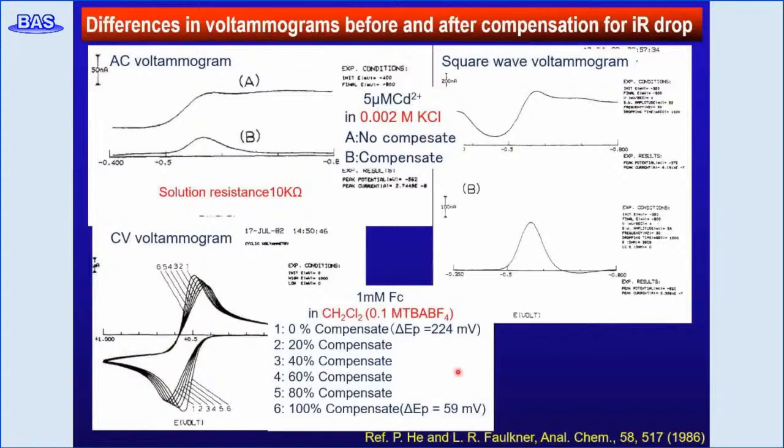Here is the actual reported change in voltammetry before and after IR compensation. The first example is the AC and square wave voltammetry of cadmium 2+ reductions. Without compensation, the peak is not visible, but after the compensation, the peak is clearly observed. Also, in the case of oxidation of ferrocene in low dielectric constant dichloromethane, the peak separation is 224 mV without compensation, which is very large, but after 100% IR compensation, the peak interval is 59 mV, which is close to the theoretical value.